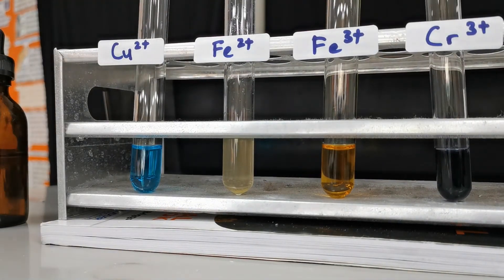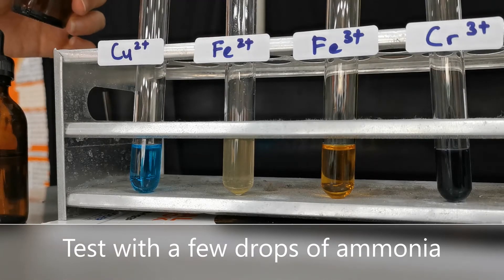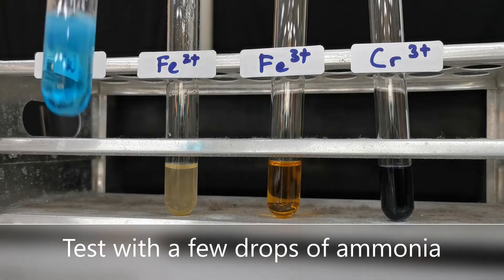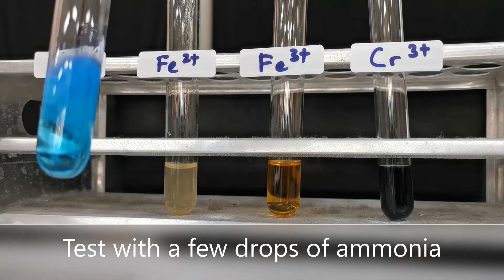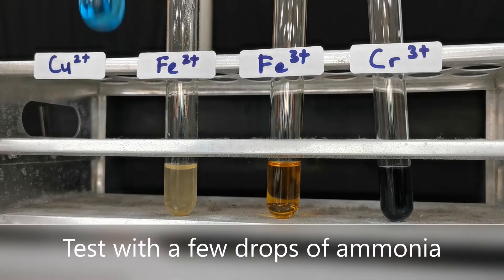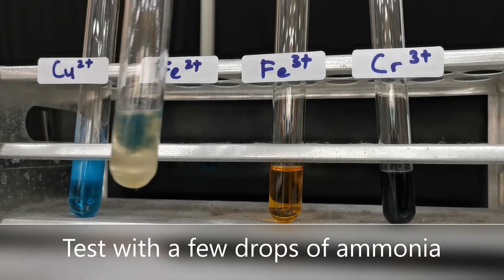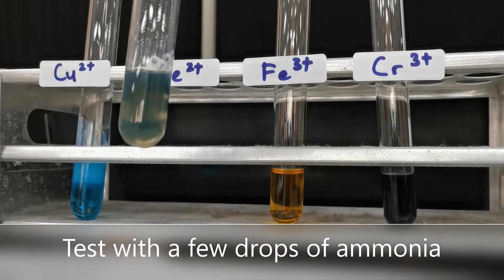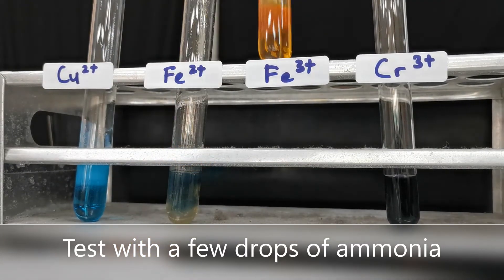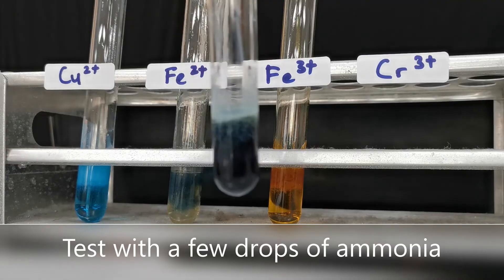The second test we're doing is using ammonia. Let's add a few drops to each of these test tubes. With the addition of a few drops of ammonia: copper(II) forms a blue precipitate, iron(II) forms a green precipitate, iron(III) forms a red-brown precipitate, and chromium(III) forms a green-gray precipitate.